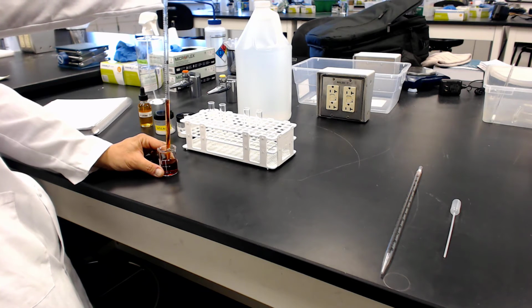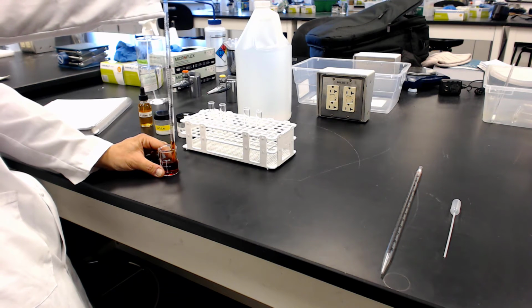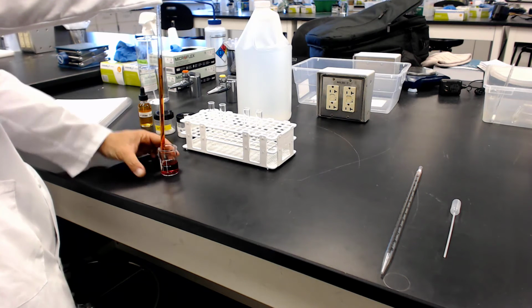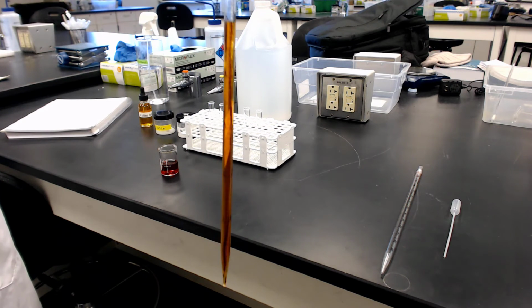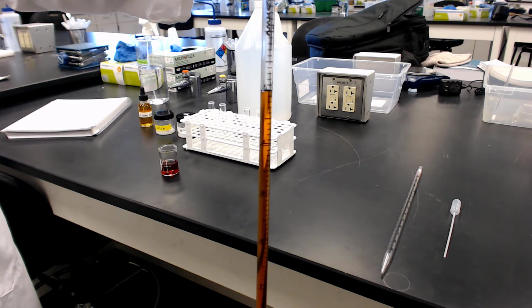So again, in this particular reaction, these are disposable pipettes. He didn't do anything to really pre-clean the pipettes. This is not a precision kind of measurement. So it's nice that you can do just kind of a little, these are throwaways. They came in, you assume they're out of the package, they're probably clean. So again, what we want to remember is we're going to add 5 mils to each of the 4 tubes.